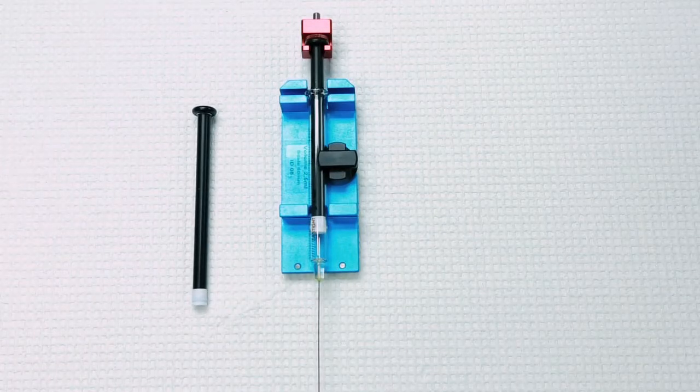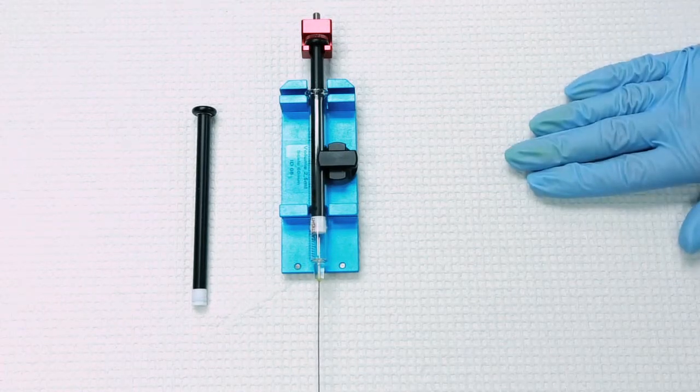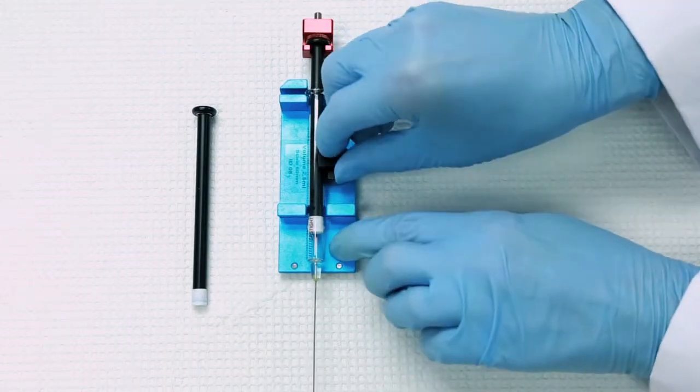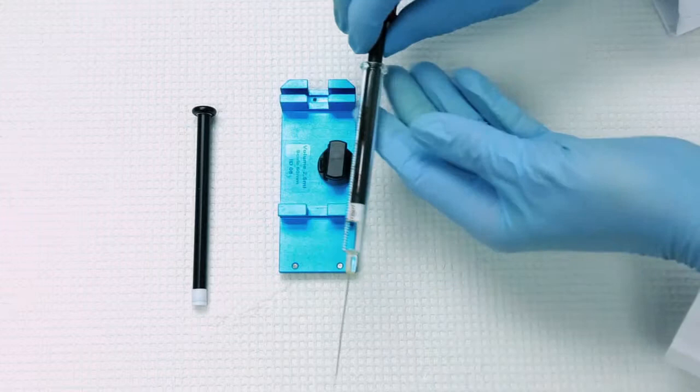After you remove the syringe assembly from the auto sampler, lie the system down on a flat surface and move the holder and remove the syringe.